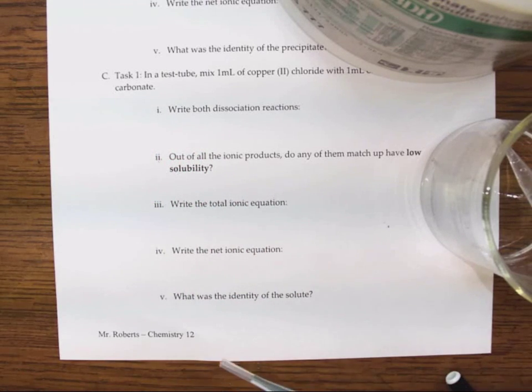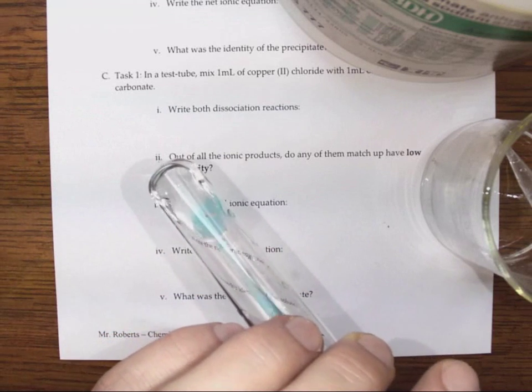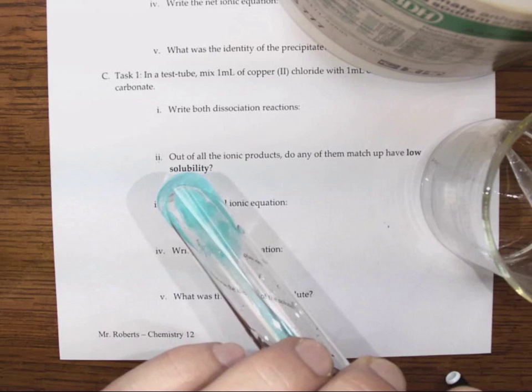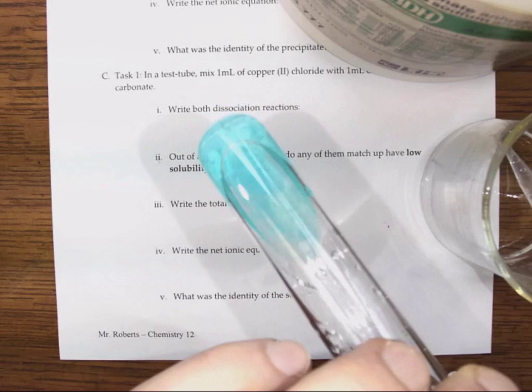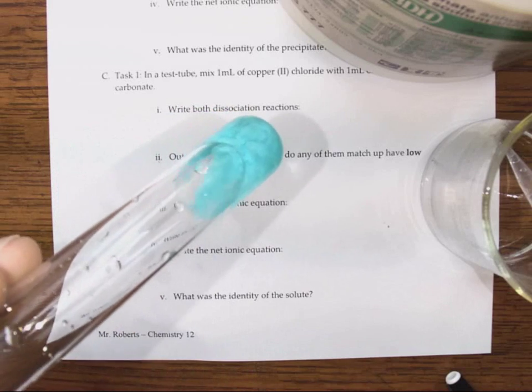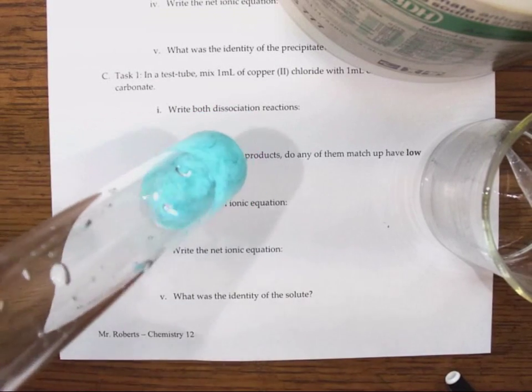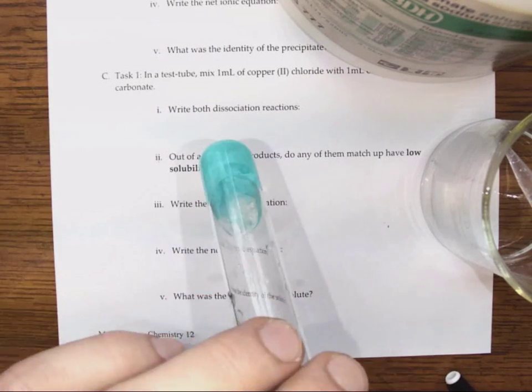Alright, so where's that test tube? Here it is. Now when I mix them, it's a little bit more subtle of a reaction. As you even put a few drops in, you can start to see precipitate, a cloudiness, a blue cloudiness forming. Oh, you can really see it on this one actually. You can see these blue clouds sort of appearing. Try and focus on that, see if that resolves it any better. Yeah, there's a milky kind of weird precipitate formed in here.